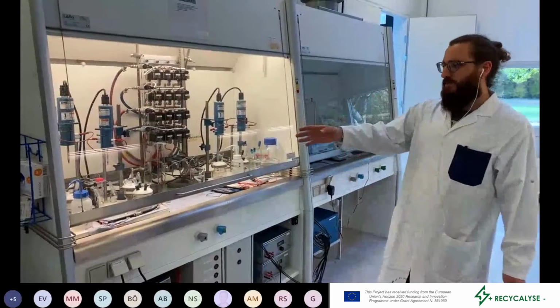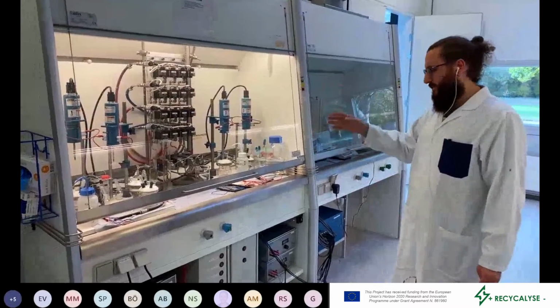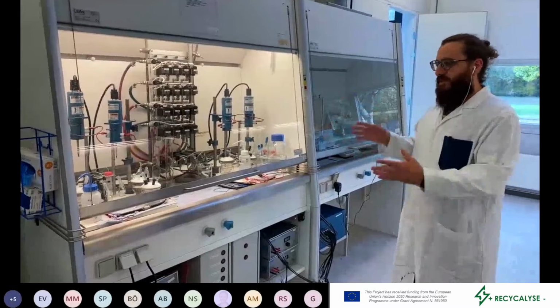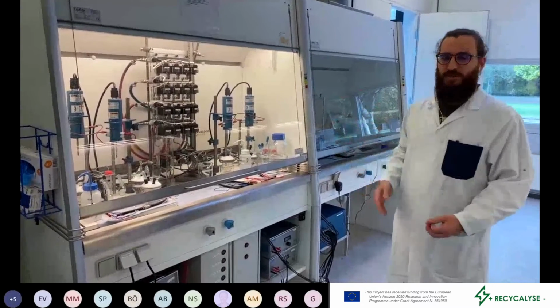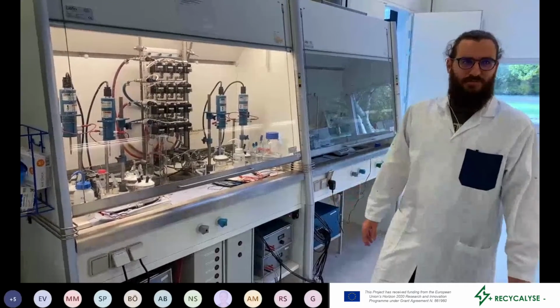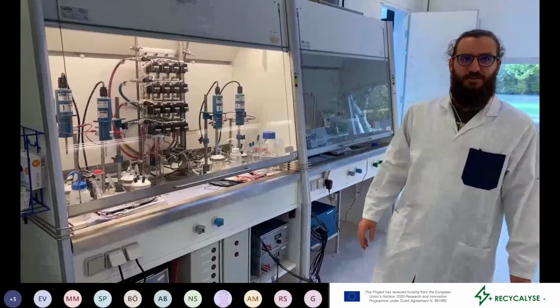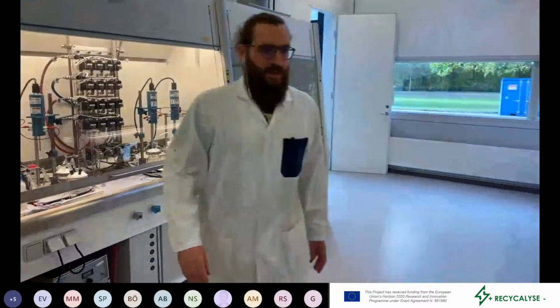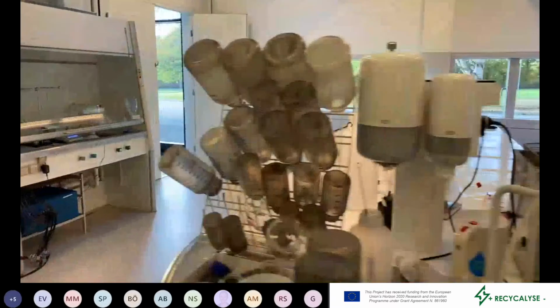Then we can get the first measurement started, set up the next one, get it also started and running in parallel. So we can have up to 4 measurements running at the same time, which greatly improves our time efficiency, especially now that we have 38 synthesis products to characterize together. And then I will lead you to the other room.